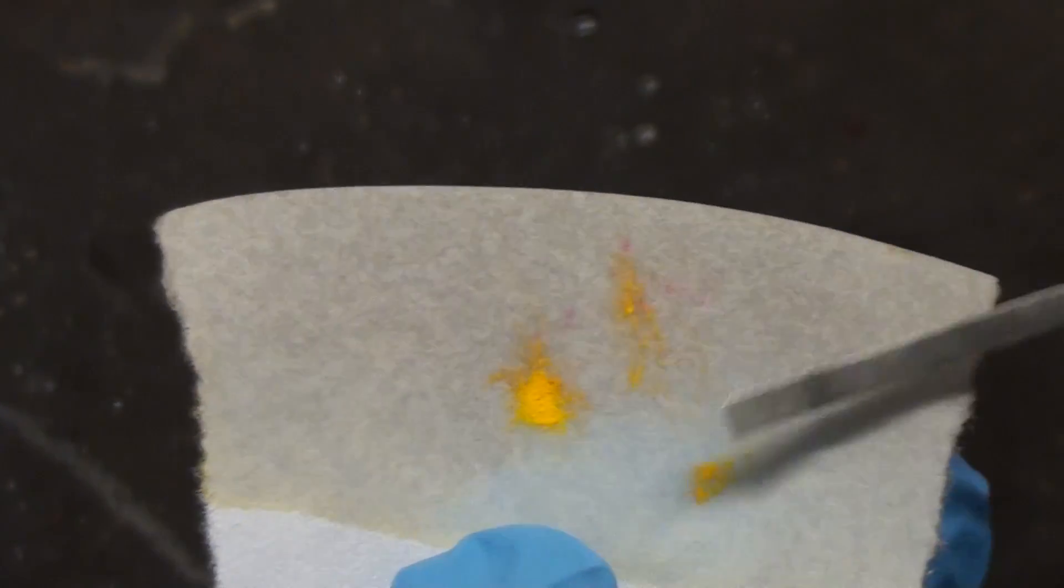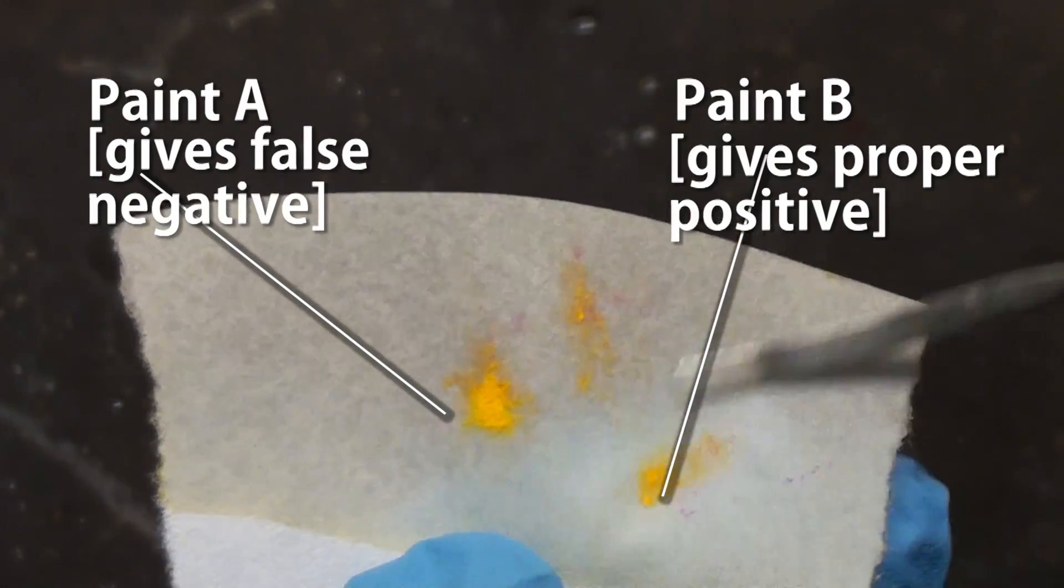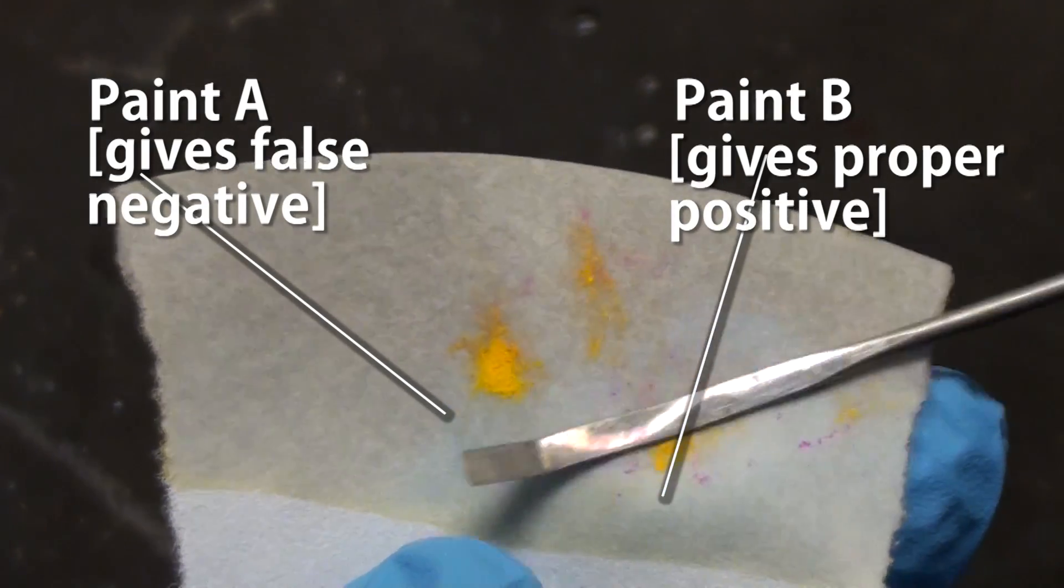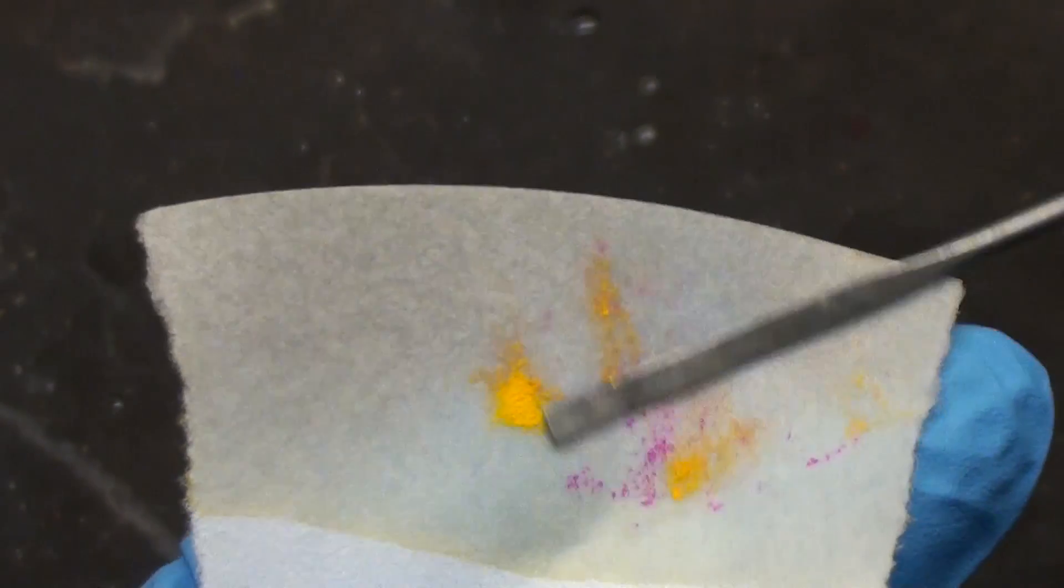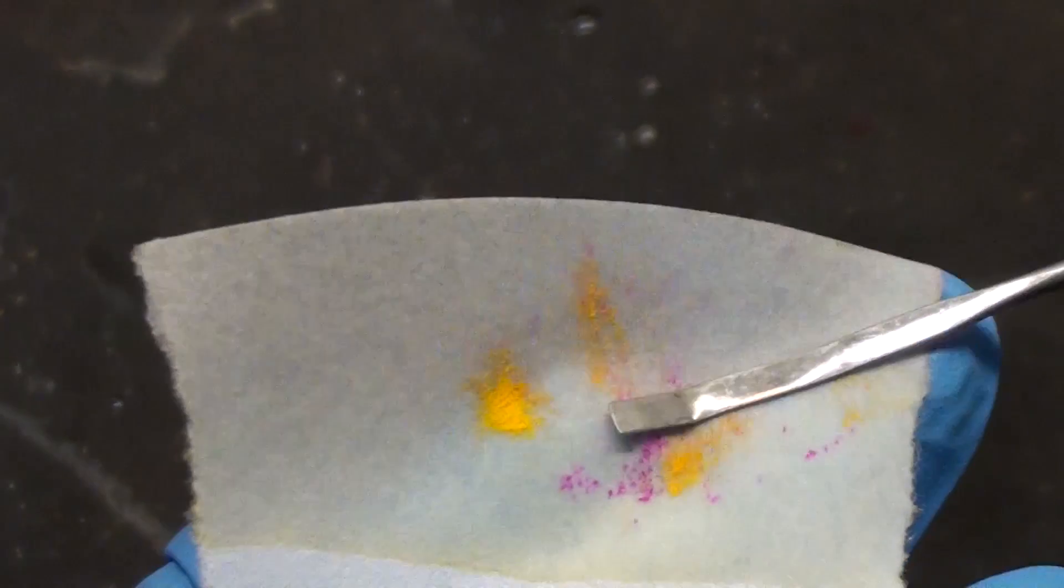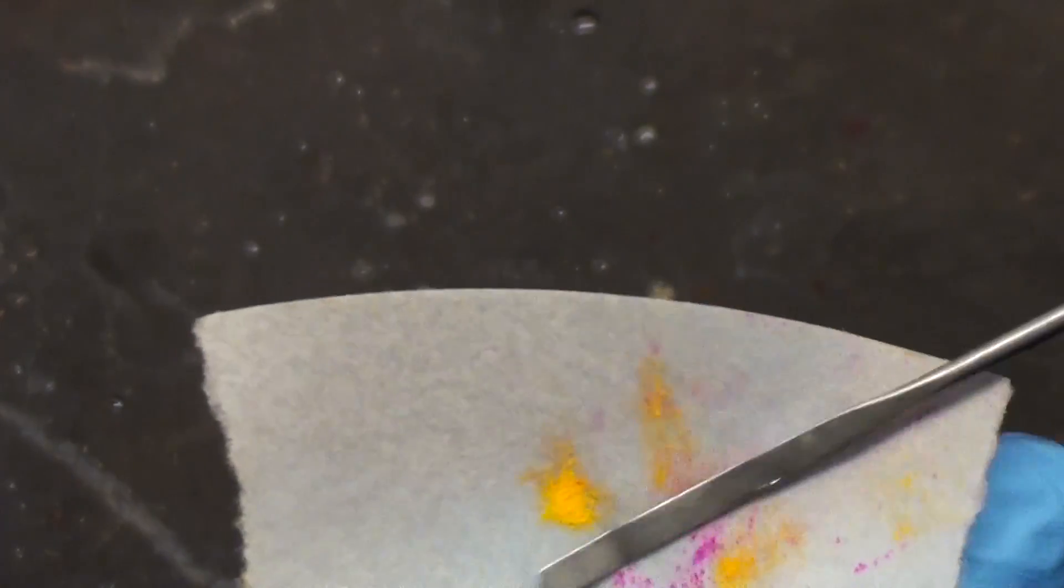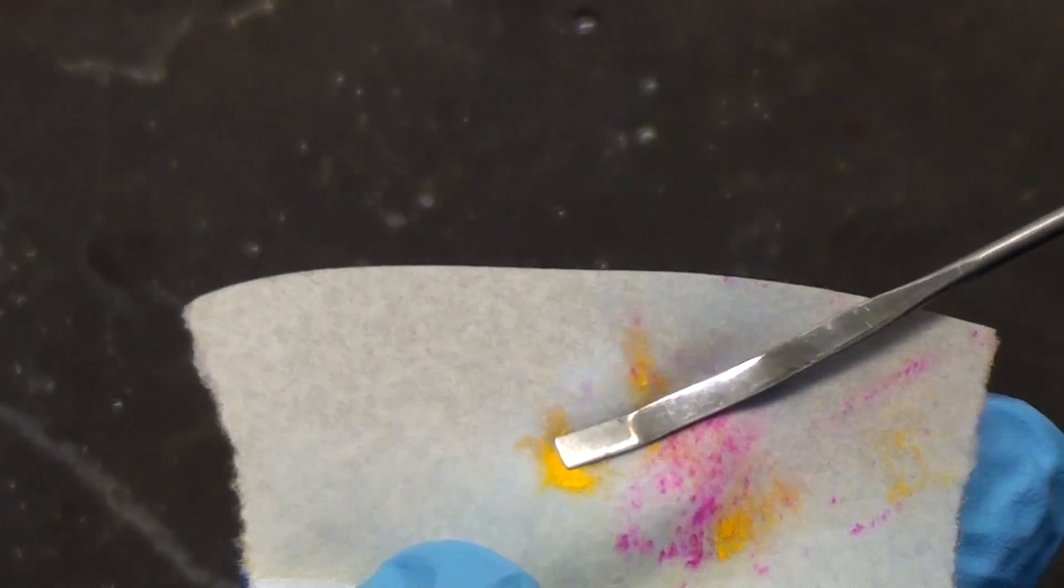I don't know exactly what's wrong, maybe I need a better test solution or the paint has some additives that gives false negatives for lead or the paint is simply too insoluble. But in any case a false negative can mislead you into a false sense of safety.